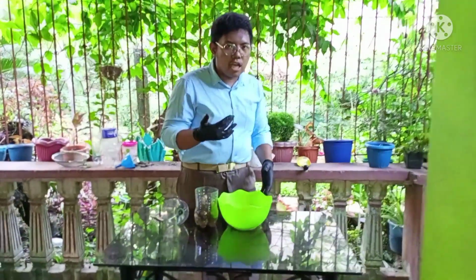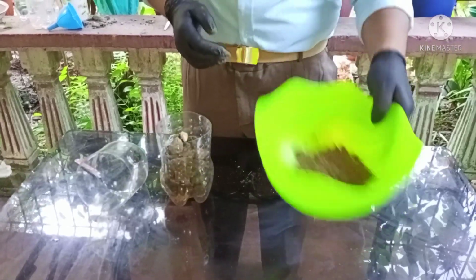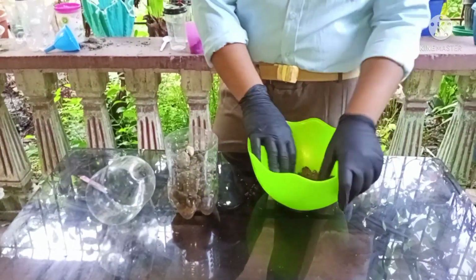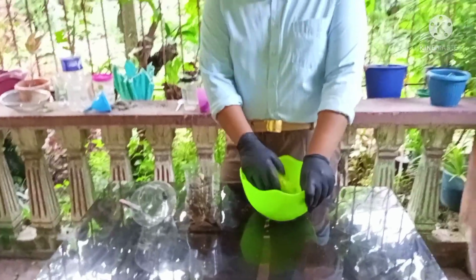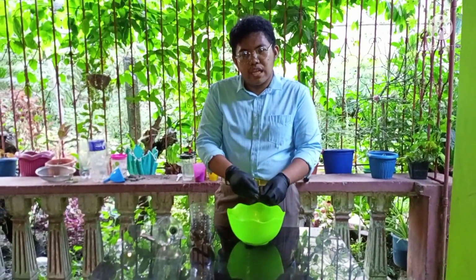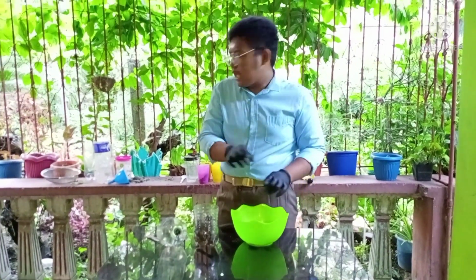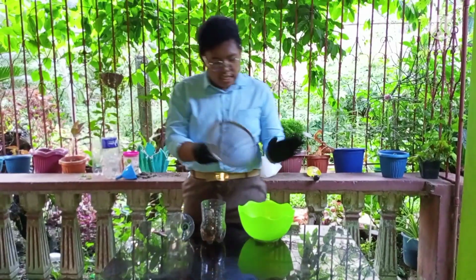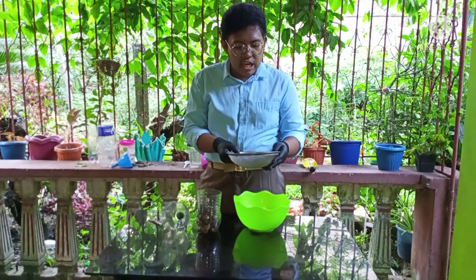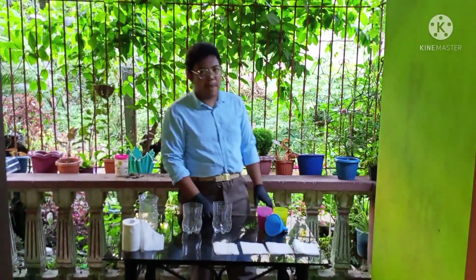Okay, camera, please zoom in. Now this is the output after doing the mechanical separation. This is the sand. The only hindrance in this first experiment is that the sand is kind of moist, so it's hard to separate the super little rocks from it. But if the sand is not moist, you can use this strainer to separate the sand and the littlest rocks. That is for our first experiment.